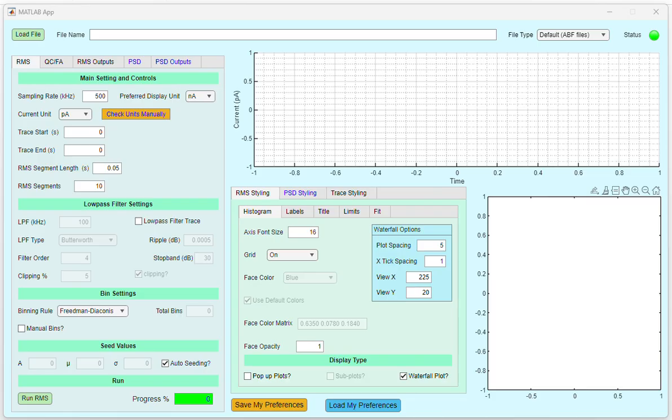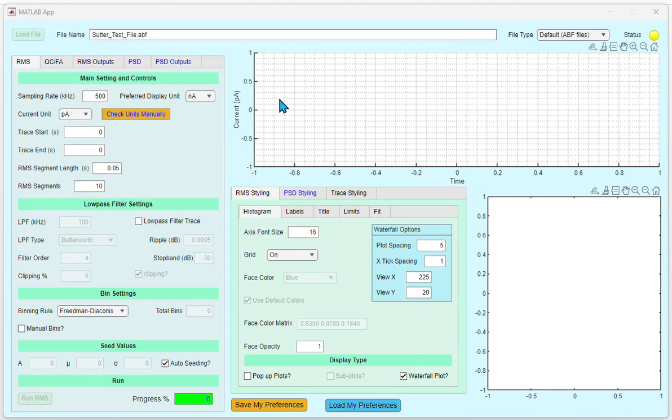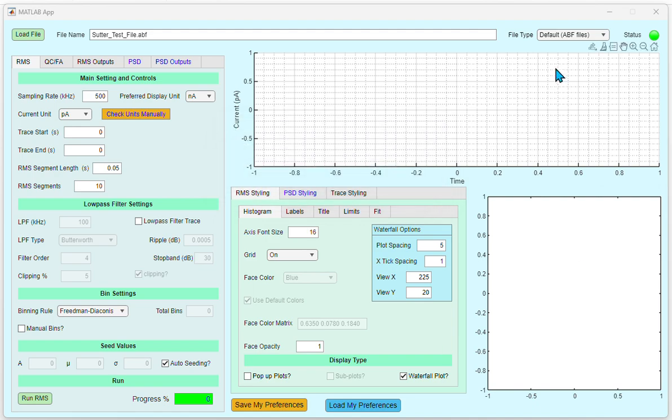In order to choose the correct file type, use the File Type drop-down menu. There are three options. The default option is the ABF files, then the Sutter ABF file option, and DAC LabVIEW-based files. If the incorrect file type is chosen, an error will pop up when loading the file. For more information about these file types, please refer to the compatible file type document included with this app.